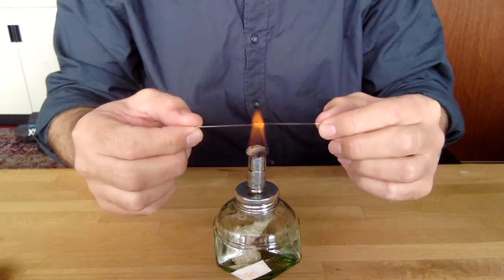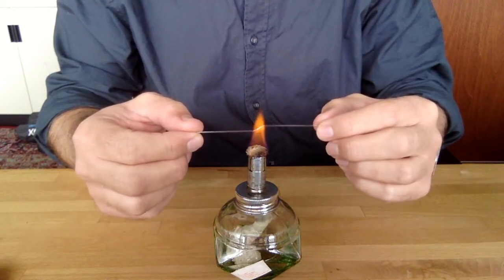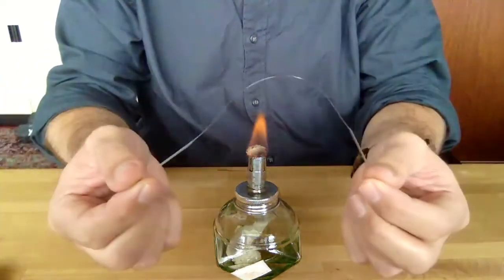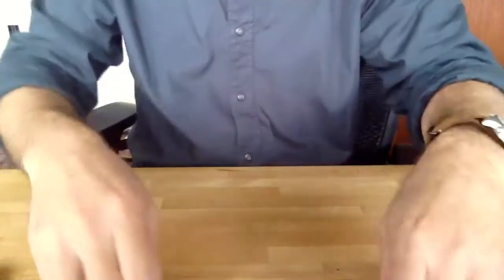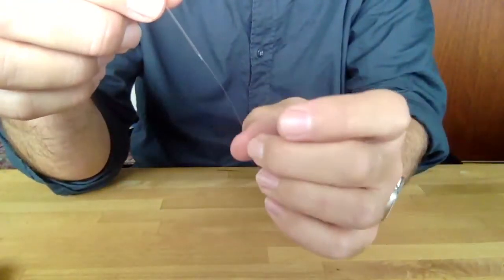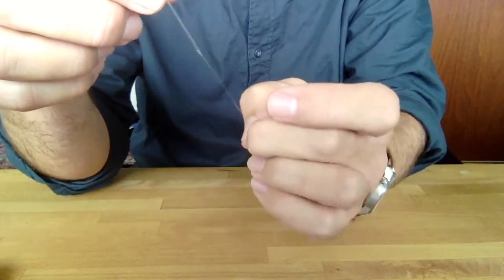So the first step is to heat up a piece of glass as though you're making a micropipette. You get it nice and mushy in the middle, take it out of the flame and stretch it. So you get a nice little thin filament of glass, and now we're done with that. What you want to do to make the lens is take this thin filament of glass and break it somewhere, a few centimeters from one of the ends. This will allow you to make two lenses.